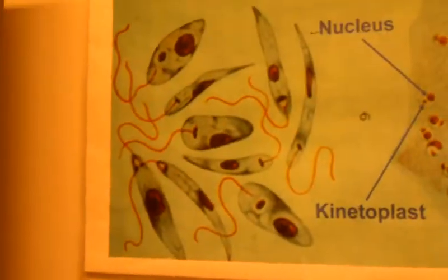See, what you're looking at are the bottom of the flask. It looks weird, doesn't it? Weird. See all the different ones. You see how they grow?